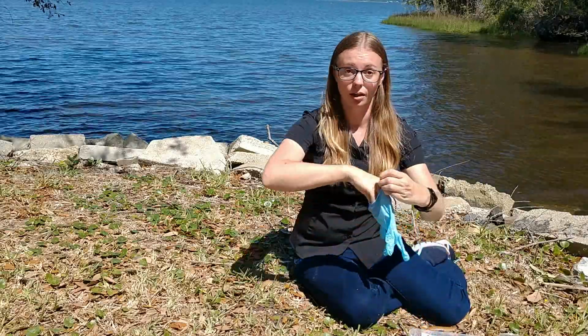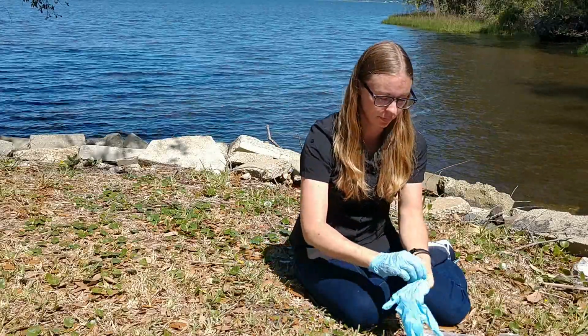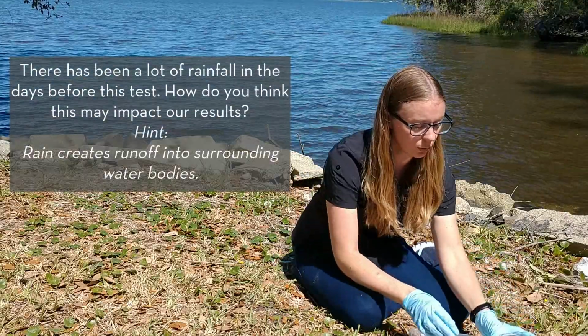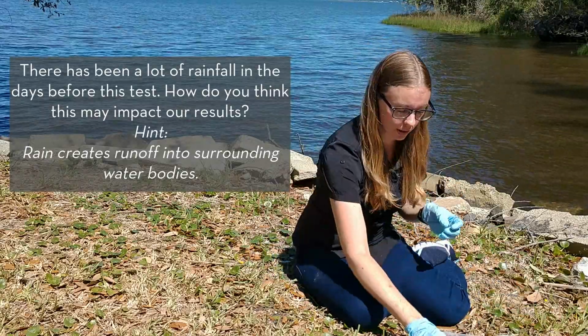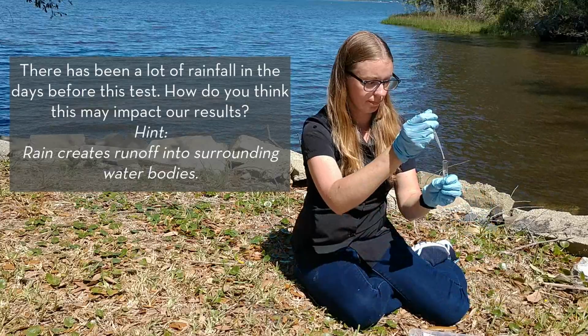So let's test the nitrate levels in our St. Johns River today, April 21st, 2020. First thing I'm going to do is put on gloves, because that is good scientific practice when working with chemicals. I have my sample of river water that I took earlier, and I'm going to take 5 milliliters of that sample and put it in this little jar.